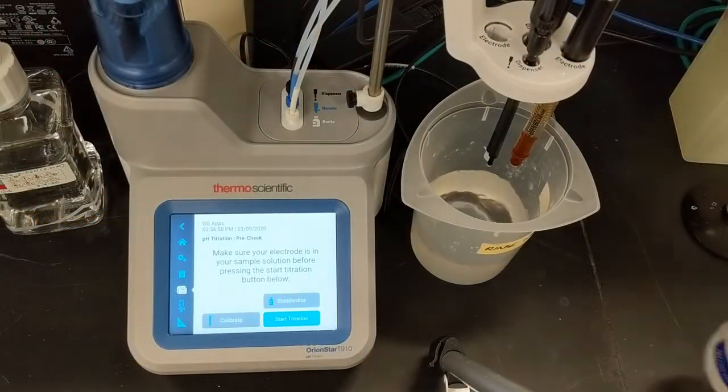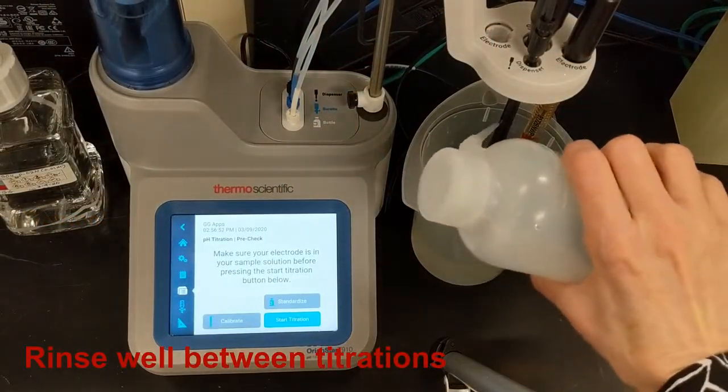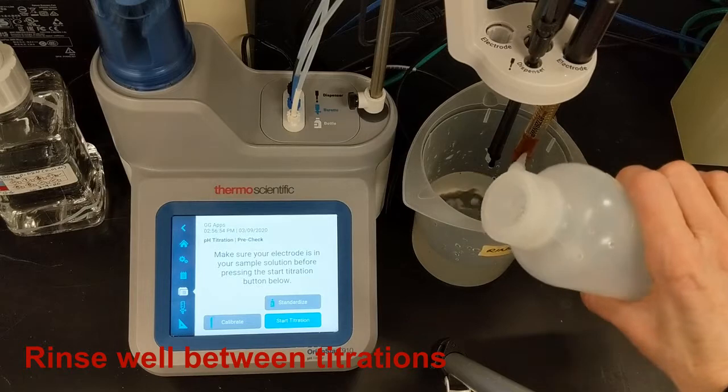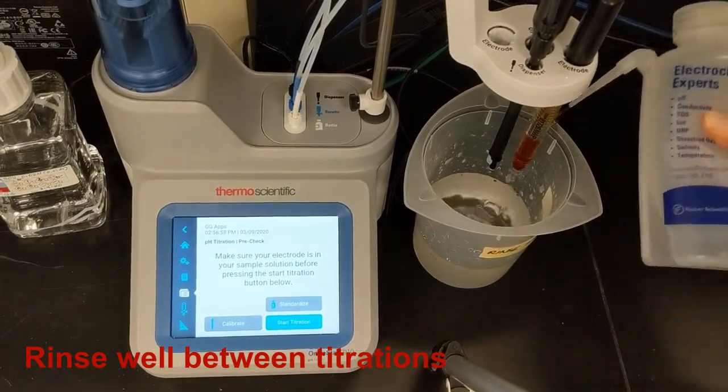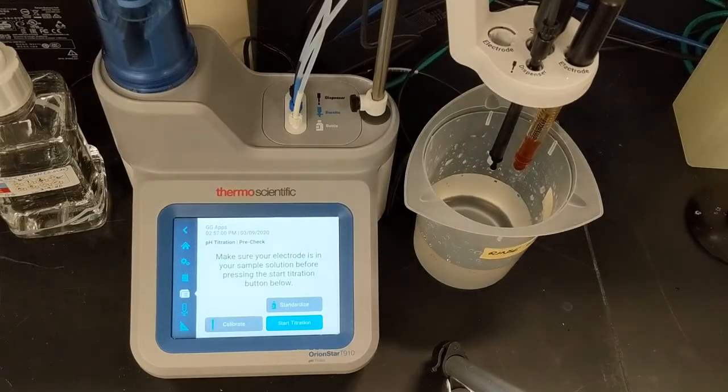As always, before I run my sample, I'll rinse the electrode, stirrer, dispenser, and ATC thoroughly with reagent-grade water to remove all traces of carryover from the last titration.